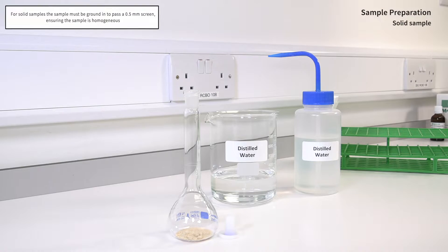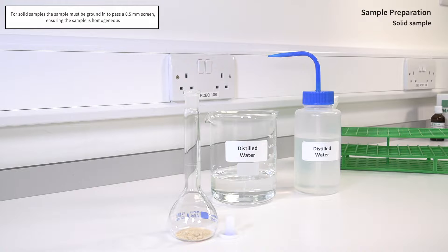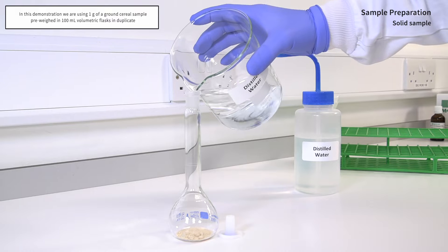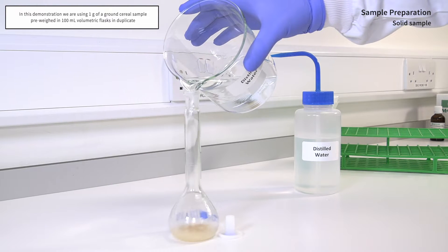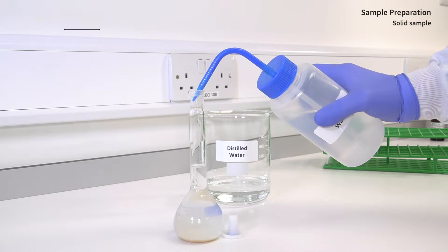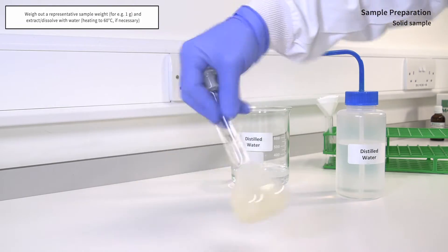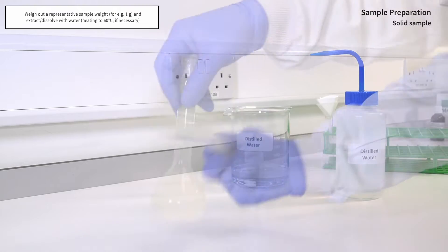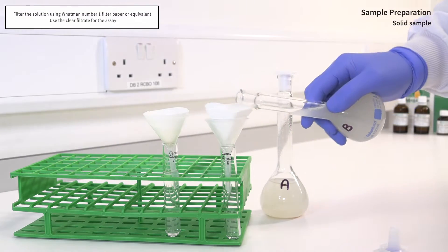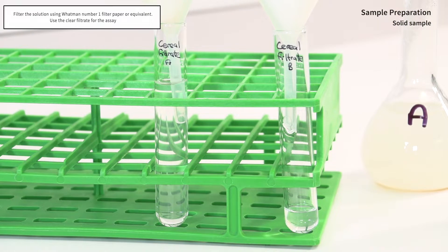For solid samples, the sample must be ground to pass a 0.5 mm screen and ensure the sample is homogeneous. In this demonstration we are using 1 gram of a ground cereal sample pre-weighed into 100 ml volumetric flasks in duplicate. Extract the sample by diluting to the mark with distilled water and mix thoroughly. Allow to extract over 10 minutes, heating if necessary. Filter the solution using Whatman number 1 filter paper or equivalent and use the clear filtrate for the assay.